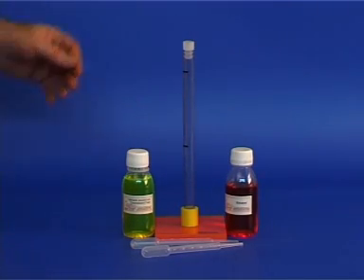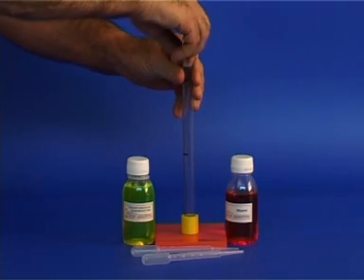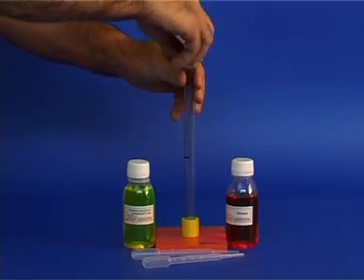We have a stand with a tube sealed at the bottom and equipped with a stopper for the top. Note the two line marks on the tube.